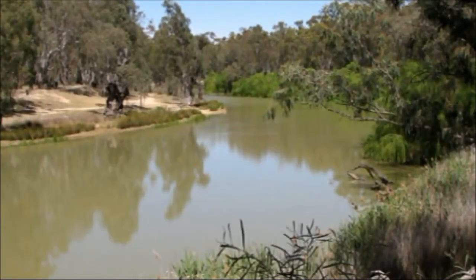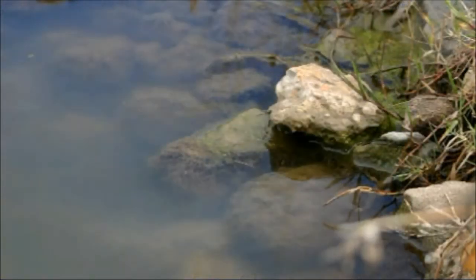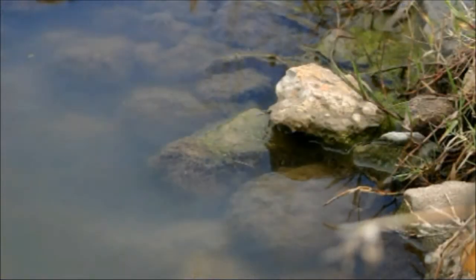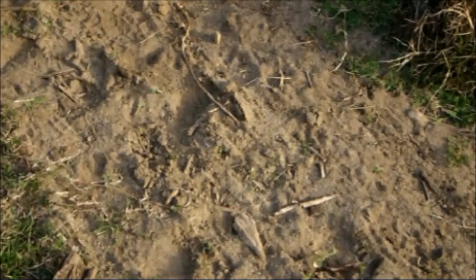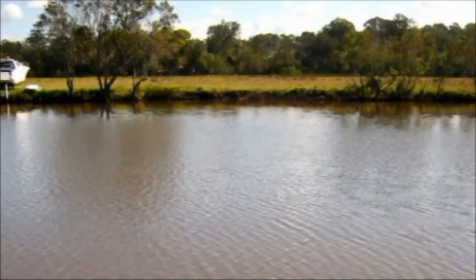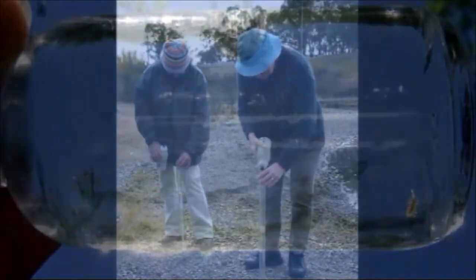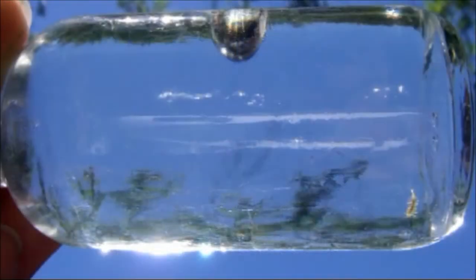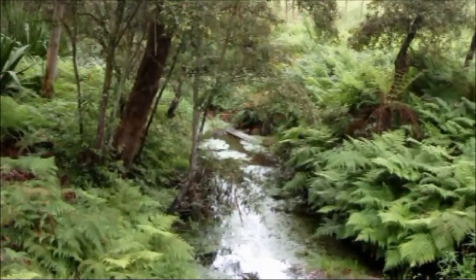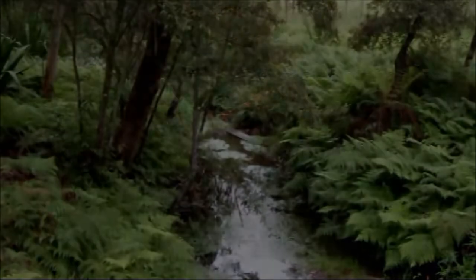Turbidity measures the muddiness or cloudiness of the water. Suspended material such as clay, silt, sand, or algae can increase the turbidity of water. Turbidity affects how much light can penetrate into the water, reducing plant growth and oxygen production or the survival of fish.